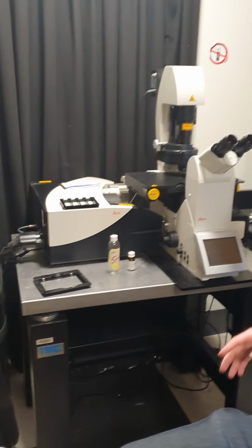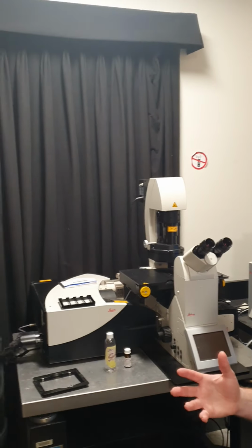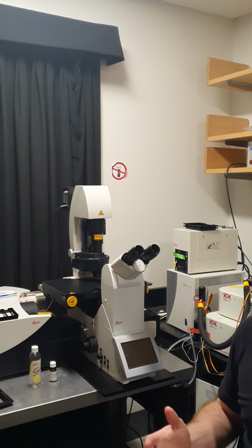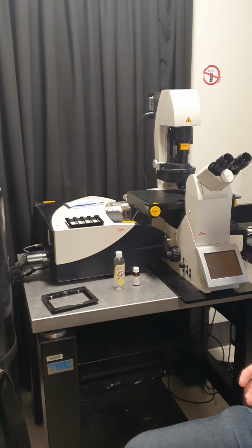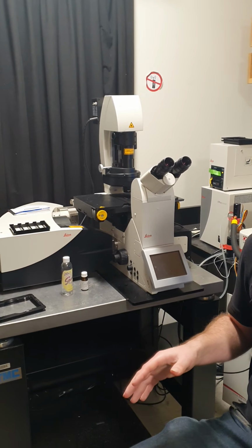To be a very multi-purpose microscope. So it can do confocal imaging, but it's also set up for doing wide field fluorescence and classical bright field imaging. So it can handle most types of samples. And we'll show you the basics of how to do all of those types of imaging.